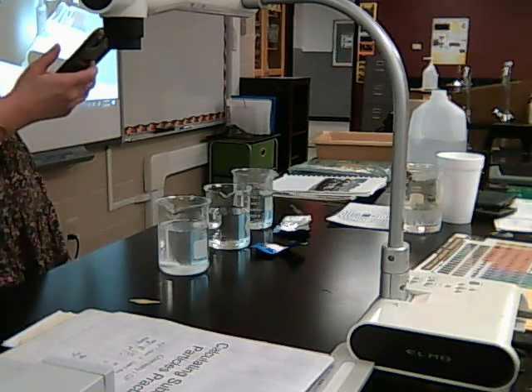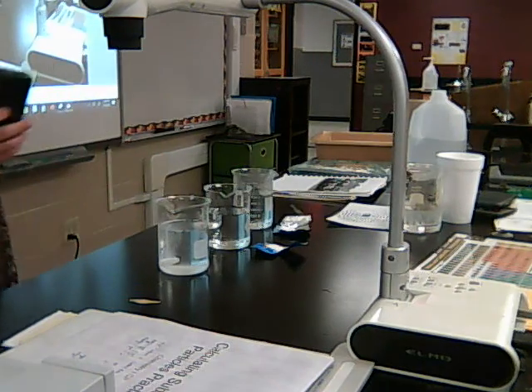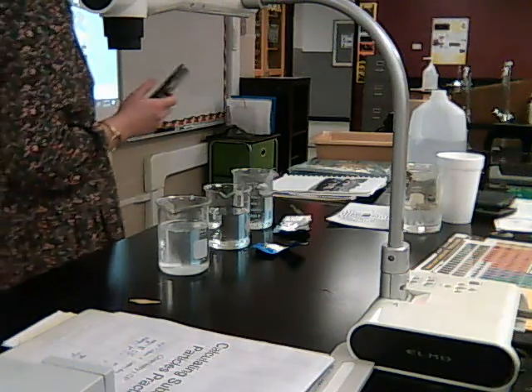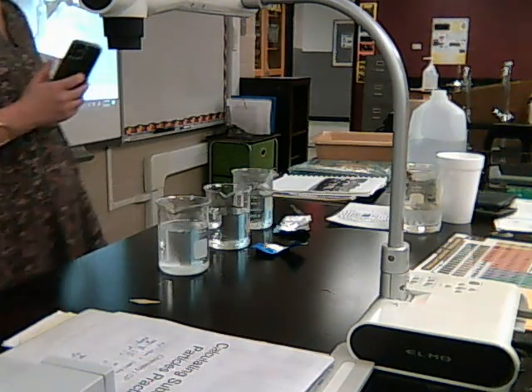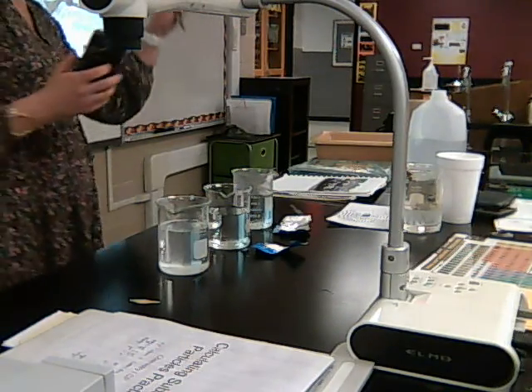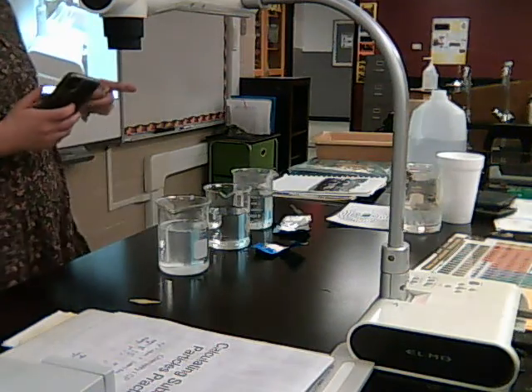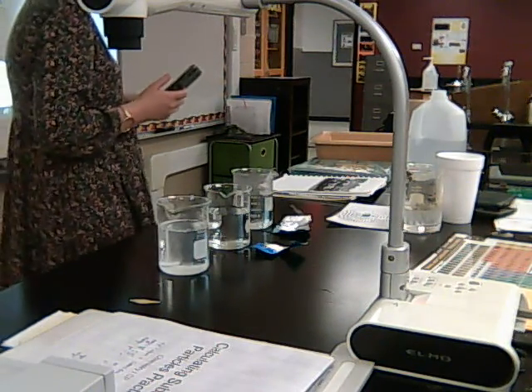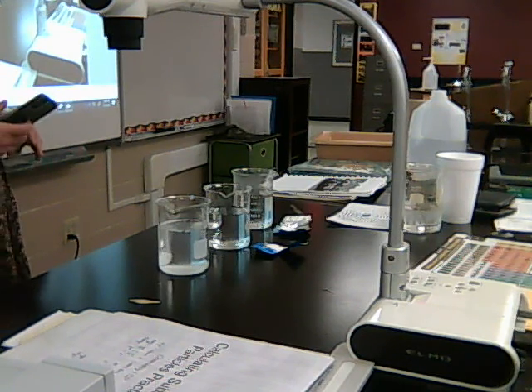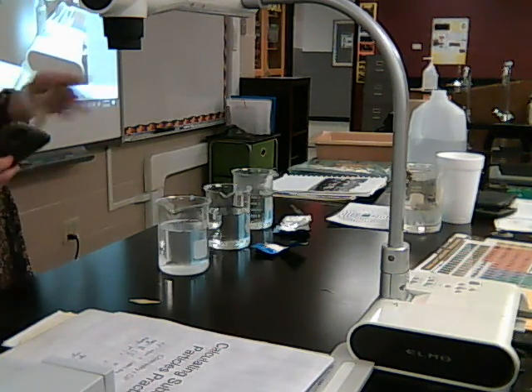Right now we're at 1 minute and 8 seconds. We're still going strong. Sometimes people want to say, well, time it until it quits bubbling. Have you ever used Alka Seltzer before? Bridget, have you ever used Alka Seltzer? No. Well, I'm glad you said time it, the time it takes it to disappear or dissolve. Because if you said till it quits bubbling, it takes forever to quit bubbling. Like we could come back 20 minutes later and it'd probably still be bubbling a little bit because it just keeps bubbling. So once the tablet is gone, that is the best time to stop it.